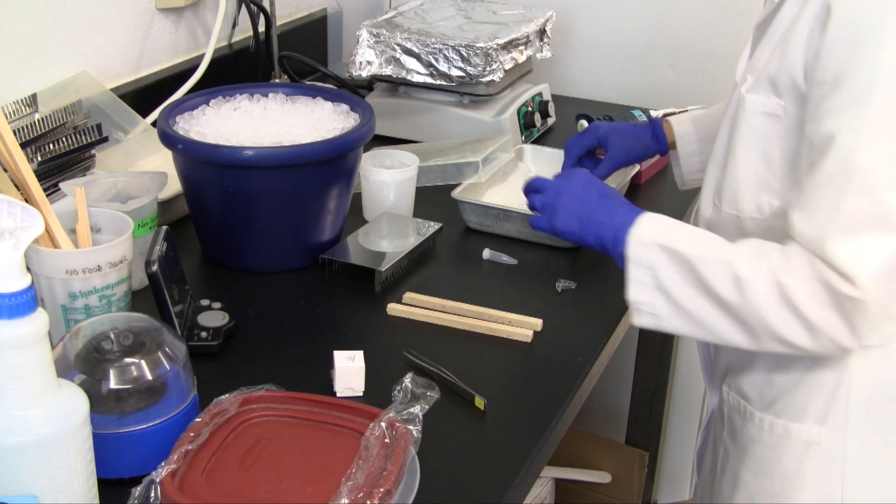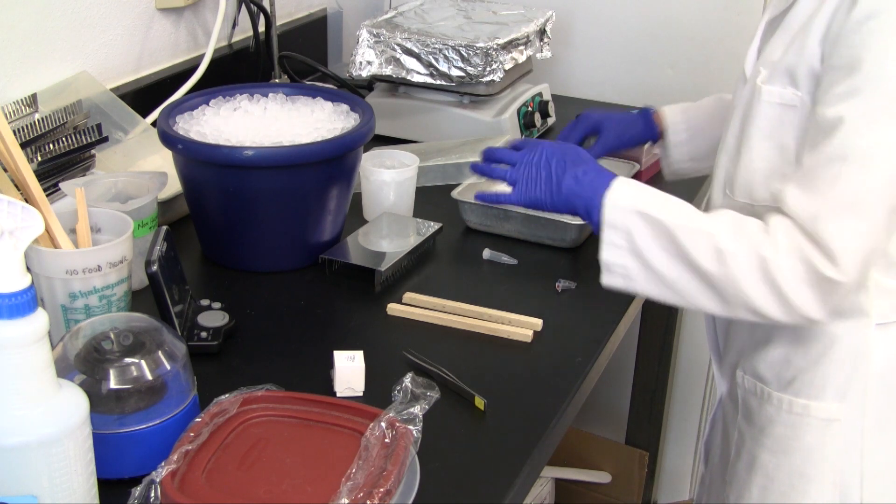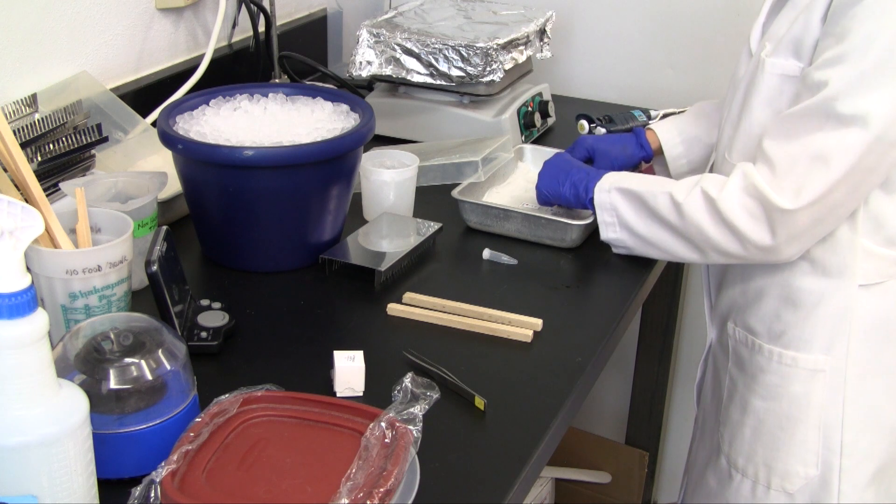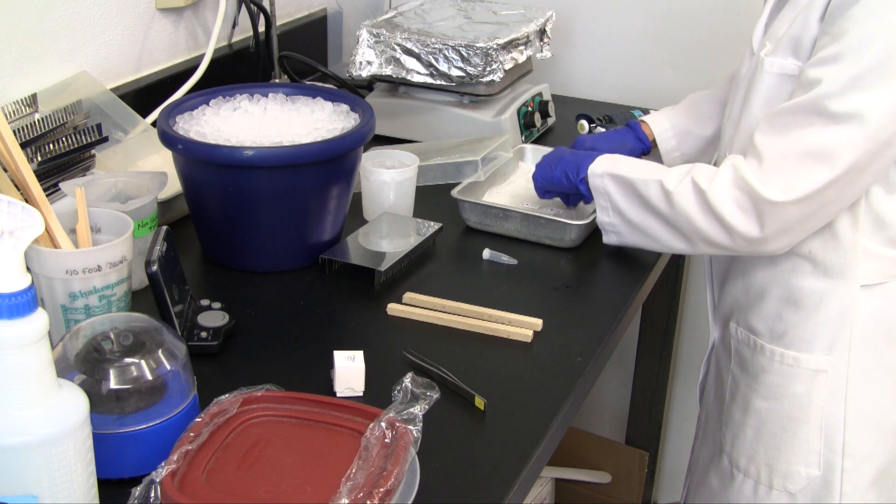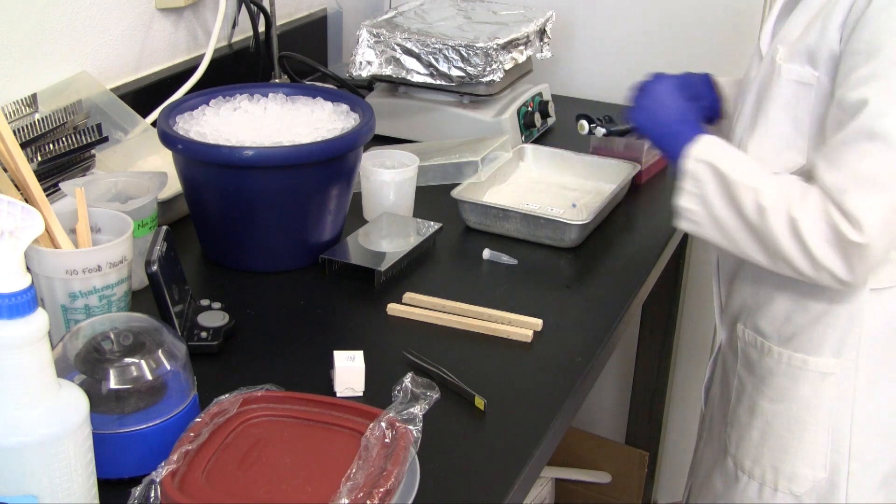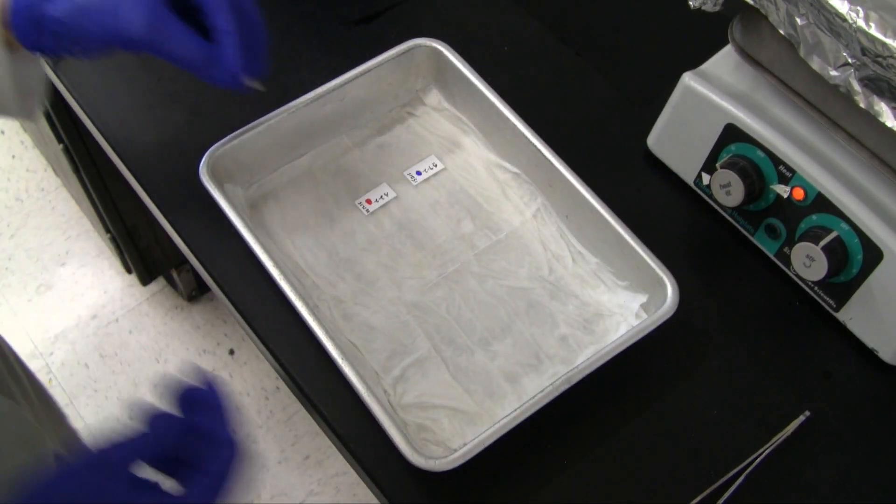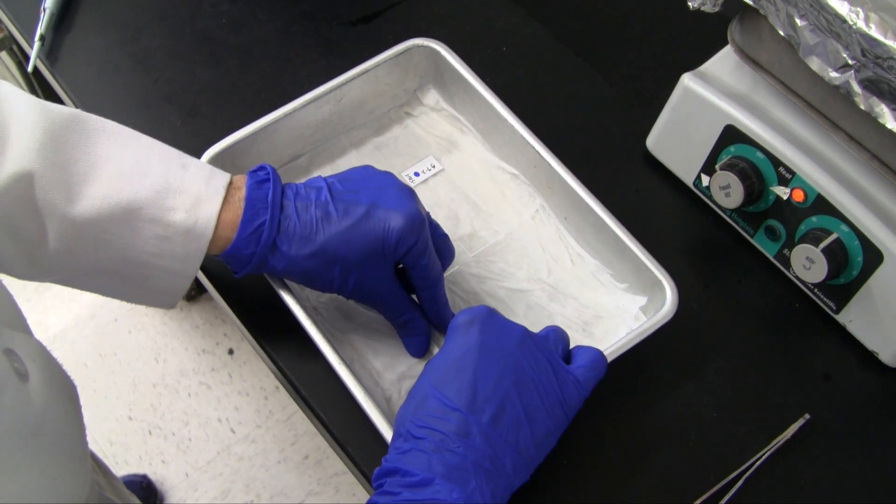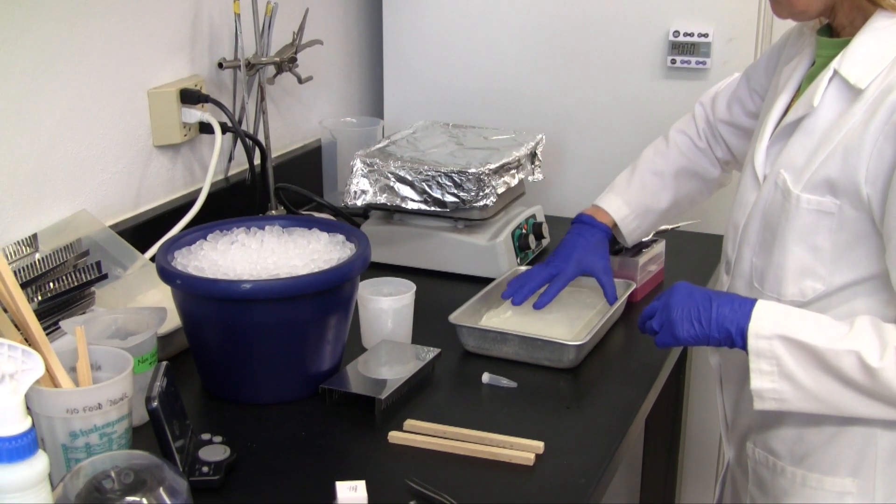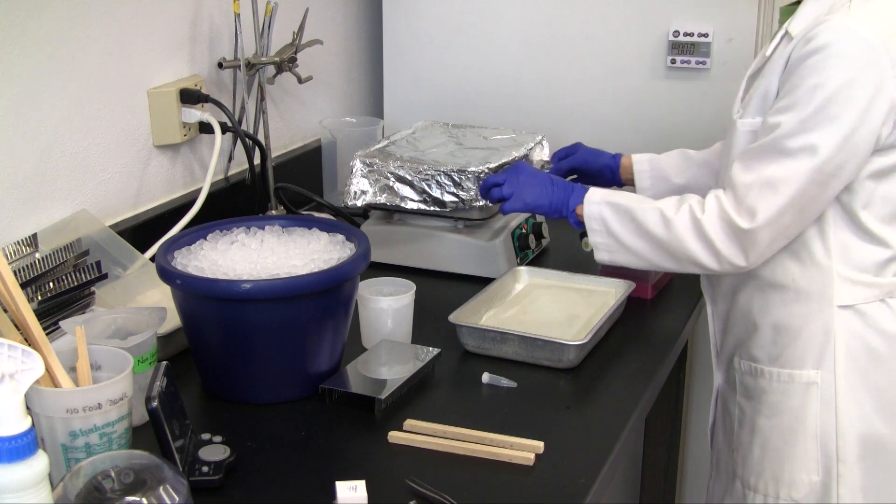The probe mixture is put in a thin-walled 200 microliter PCR tube. Probe for several slides can be denatured in one tube. The slides and probe tubes are then placed on moist chem wipes lining the water bath insert. The slides and tube are pressed down to assure good contact, covered for protection against condensation, and the tray placed in the boiling water bath.